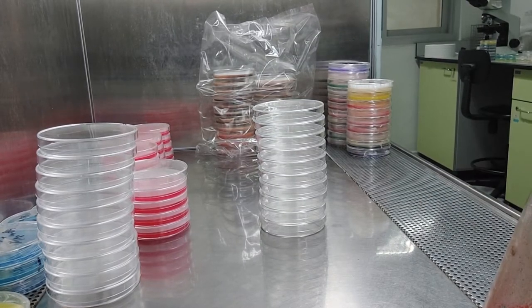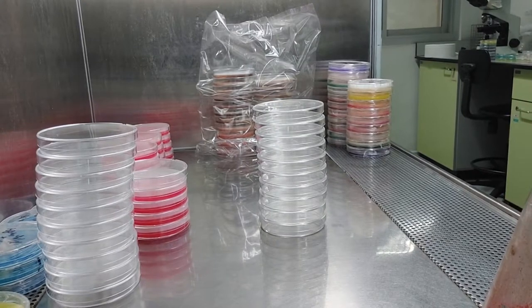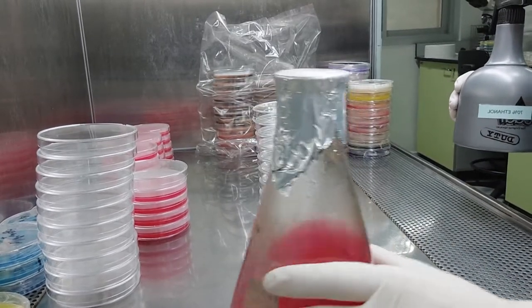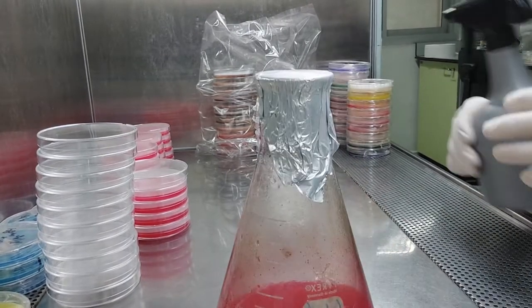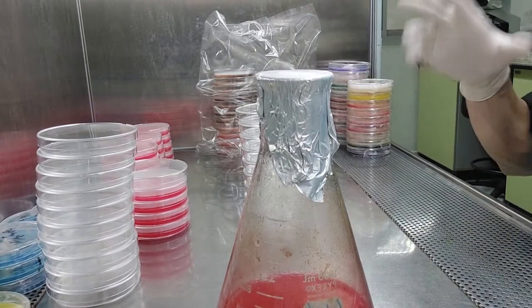Hello everybody. I'm going to talk a little bit louder because I'm in the hood today. I just wanted to make a real quick video to show you how I pour agar plates. They also start saying it like we do in Michigan — 'auger.' Which if you're from Michigan, you know augers are for ice fishing, drilling holes.